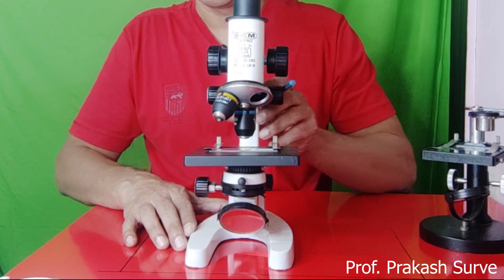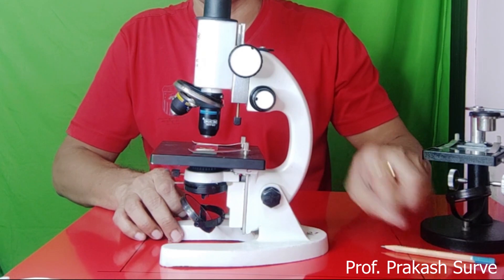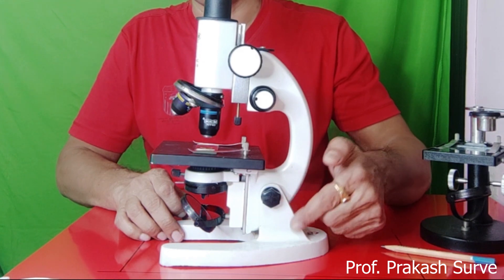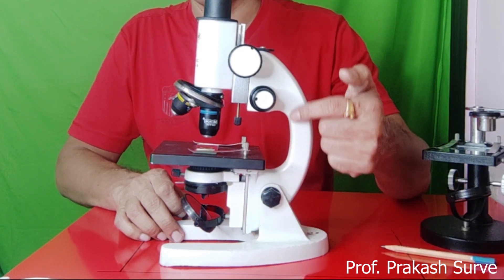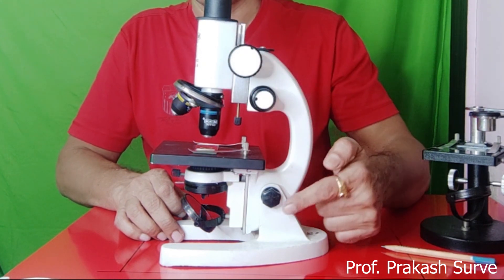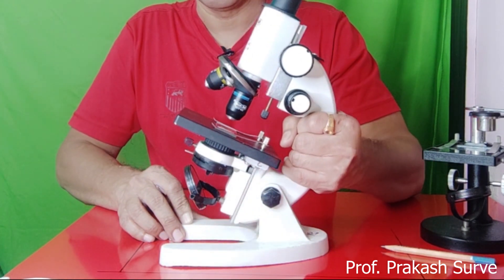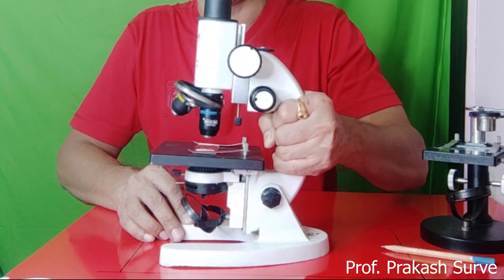Next is the arm. The arm is a curved metallic handle connected to the base by the inclination joint, and to the body tube on the upper side. It is used for tilting the microscope if required for observation in the sitting position.